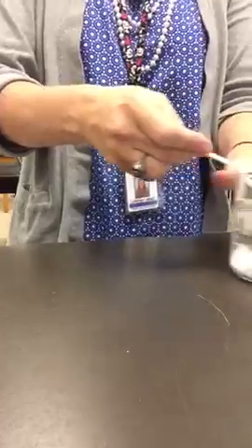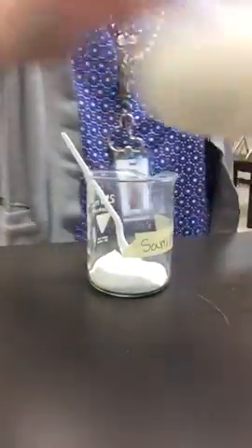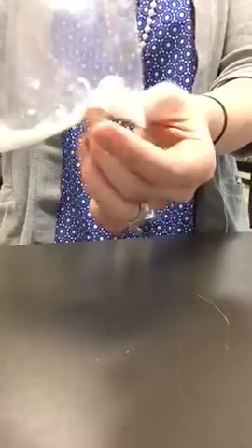Sample 1, just a spoonful, and a little bit of sample 2. Pour it in. All right. Let's see, and seal it up. Mix it together, and it's a little bit clumpy, but I'm thinking no real change has been made. Maybe a physical change because the texture's changed and it's dissolved, but I'm not sensing any chemical changes.